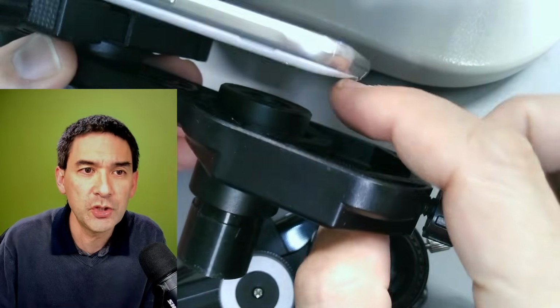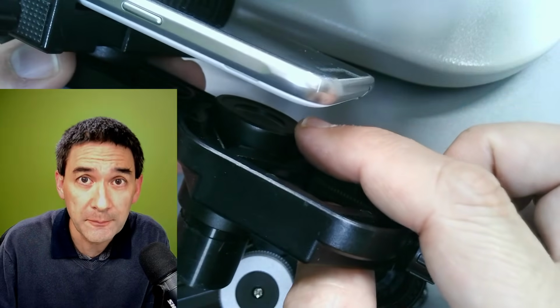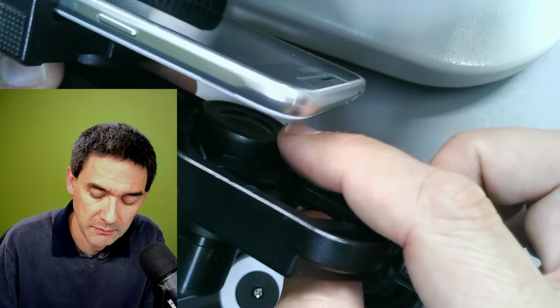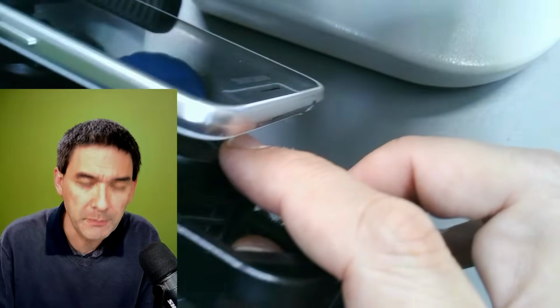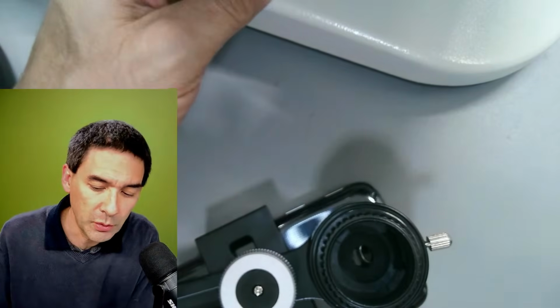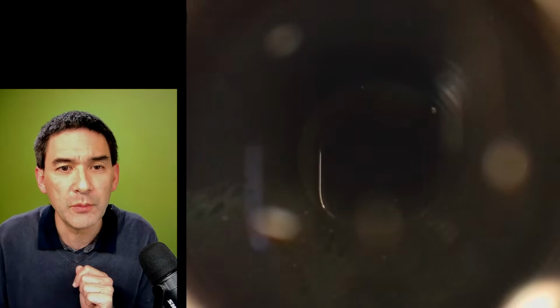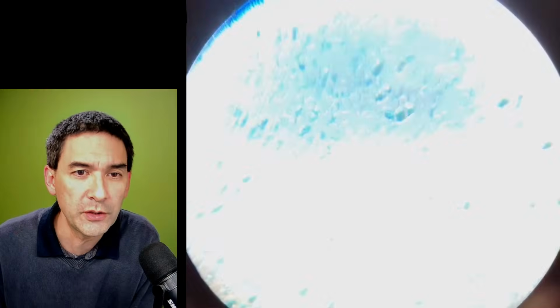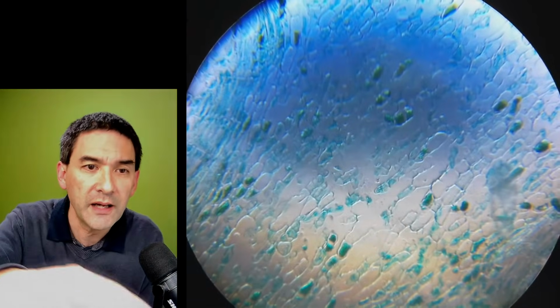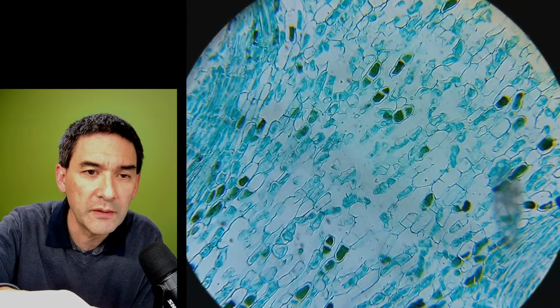Slight disadvantage, if there is a little gap here, there might be the problem of stray light, but not a big thing, but I can also show you. Just let me put this in here. Okay, so it's back again. Let me turn off this here. I'm going to now switch over. And basically what you're seeing right now, that's now the camera view, the microscope view I turn on. Here, that's it. You see, it's not perfectly centered.